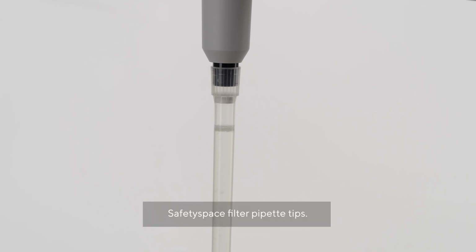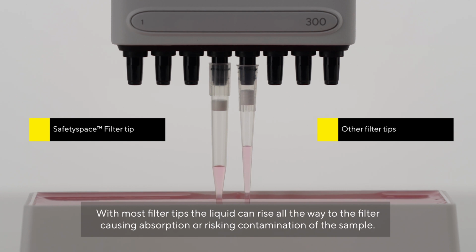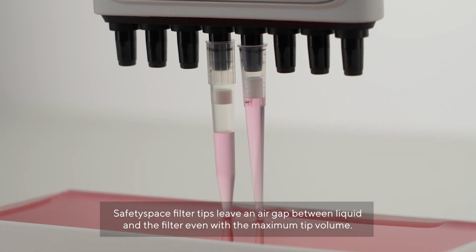Safety Space Filter Pipette Tips. With most filtered tips, the liquid can rise all the way to the filter causing absorption or risk of contamination of the sample. Safety Space Filter Tips leave an air gap between liquid and the filter even with the maximum tip volume.